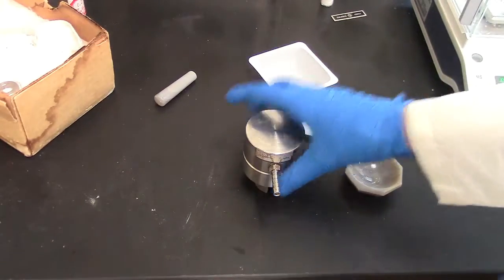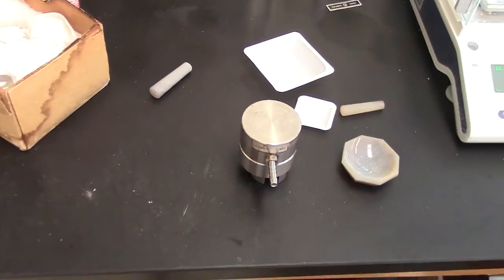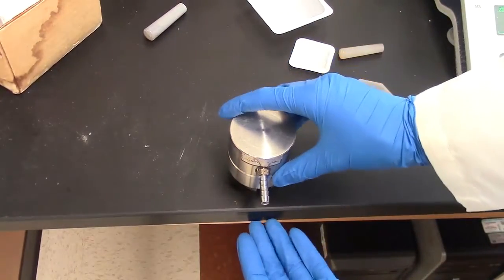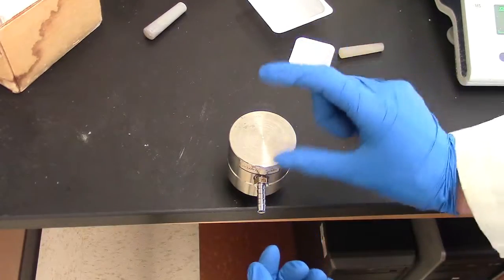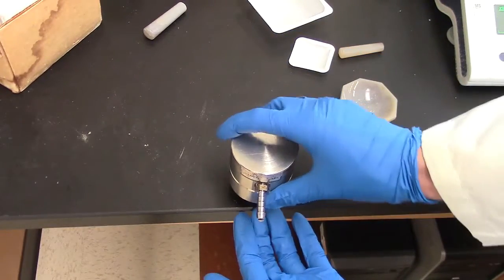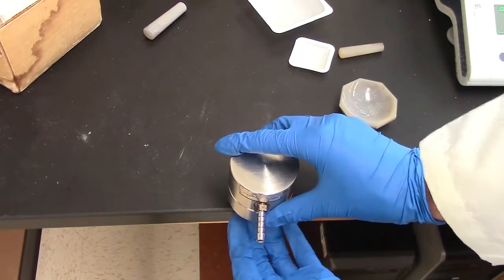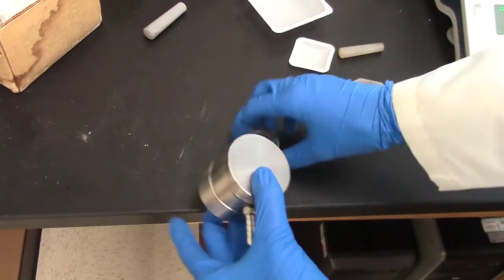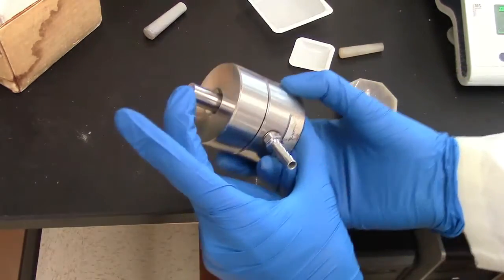Next, we take this and place it on top of this. And we carefully slide it down, being sure to hold that long metal piece that we stuck in first. Carefully grab that by the bottom as you're scooting it out.